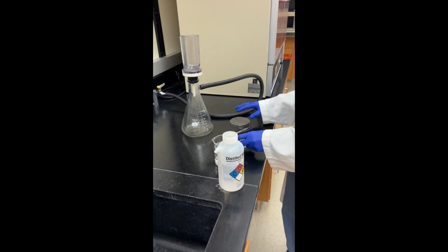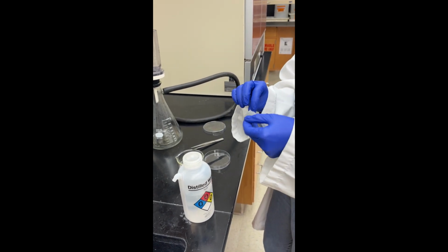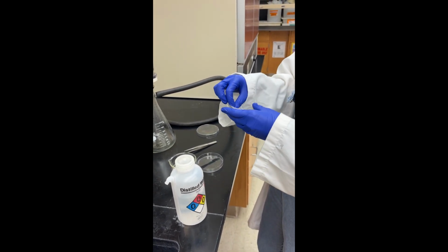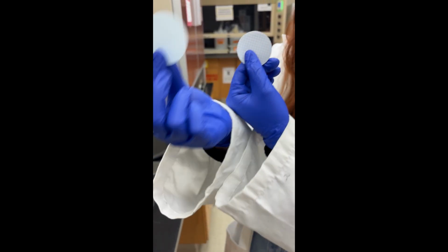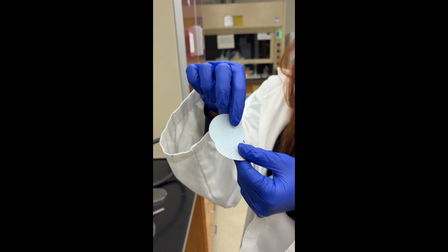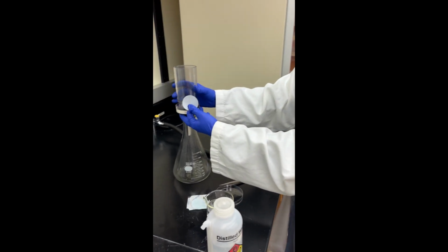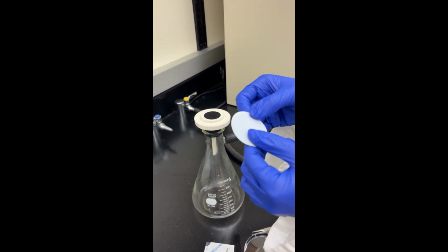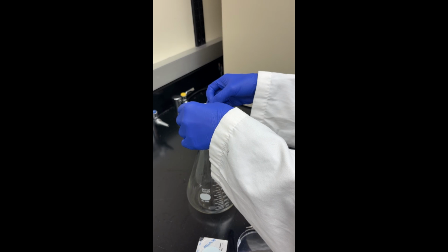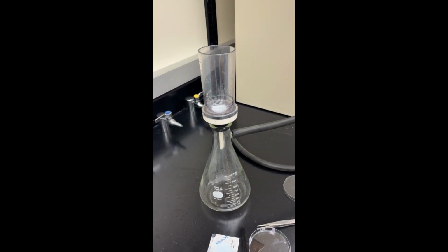To set this up, you get your filter paper, you peel it, and there are 2 pieces in here. There's one with a grid on it and this is just a cover, so you don't use this, you use this. So to run this experiment, I open this. My grid side goes up. I place it there, and I place the lid back on it.